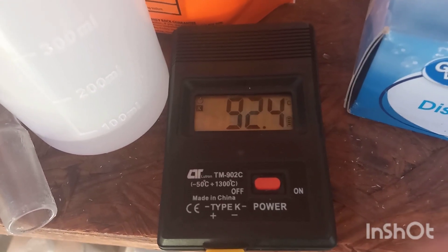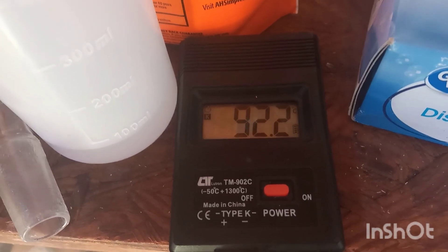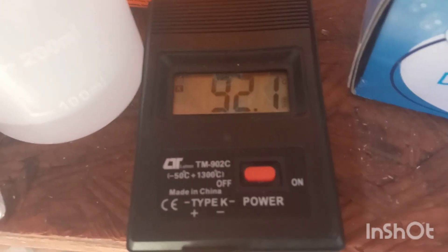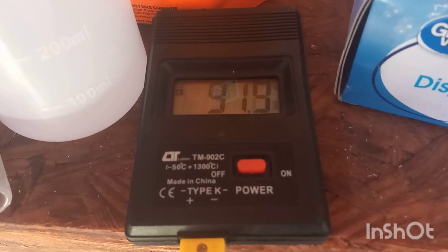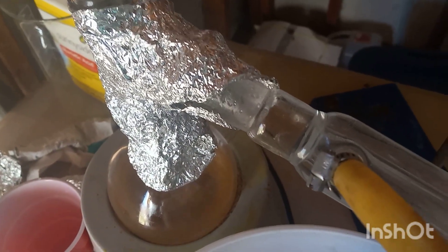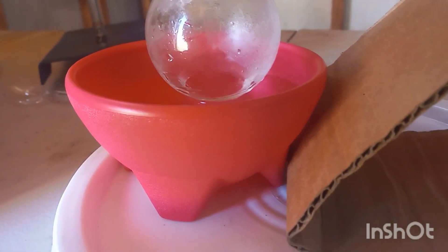We went up to 94, and as you can see we're dropping — pretty quickly too. So after about three hours of reflux, followed by allowing the mixture to hit the distillation head, we are dropping. Here we go — product.